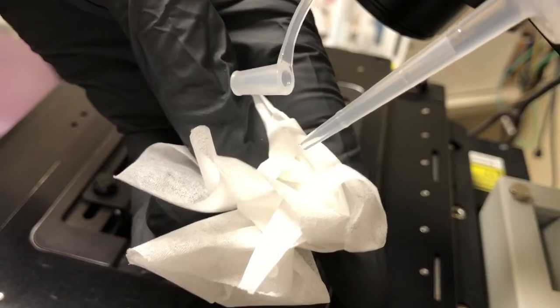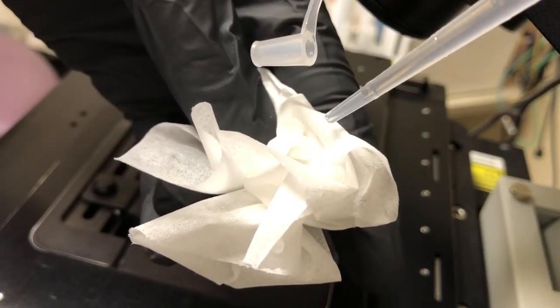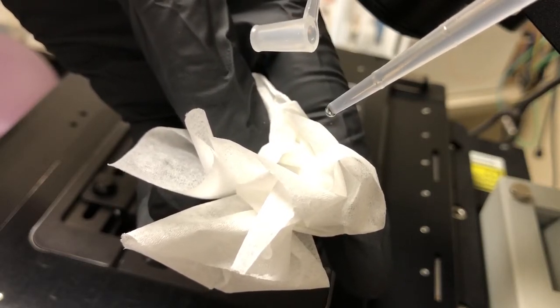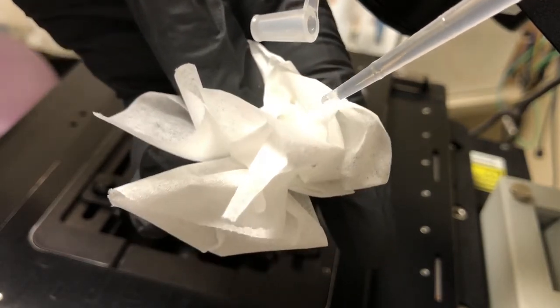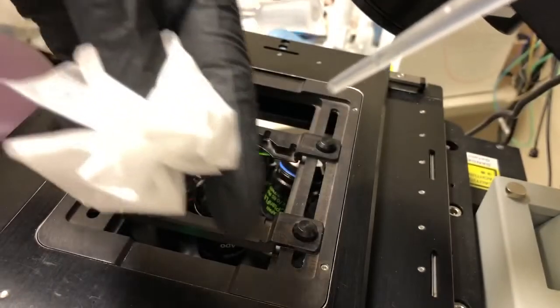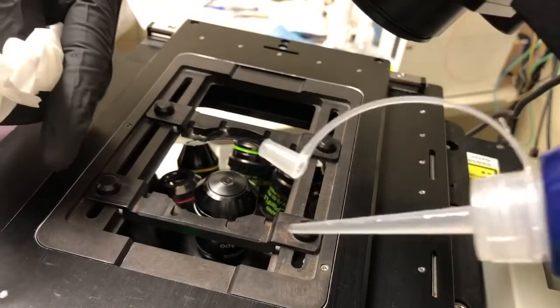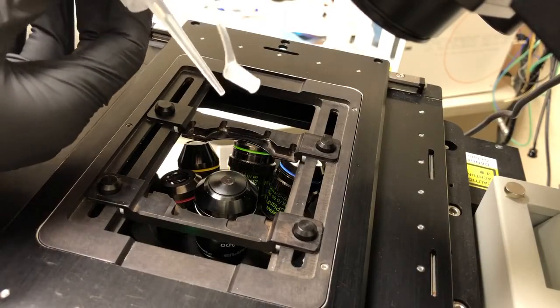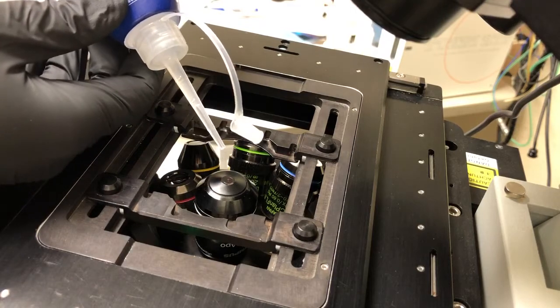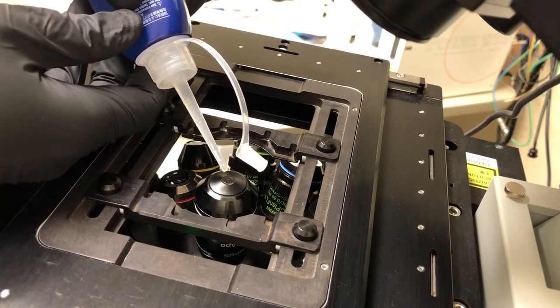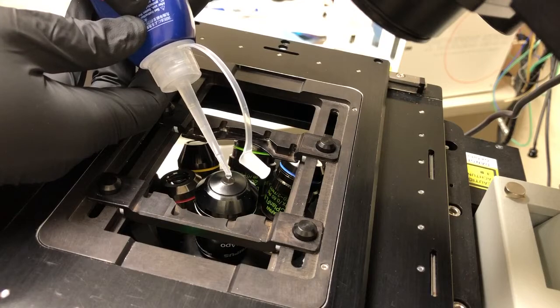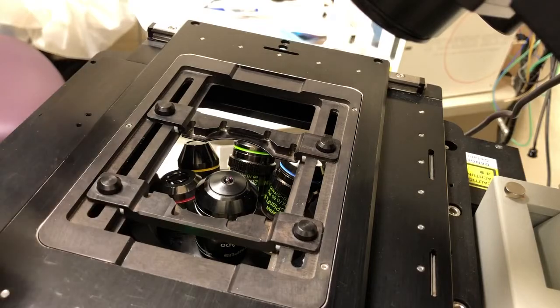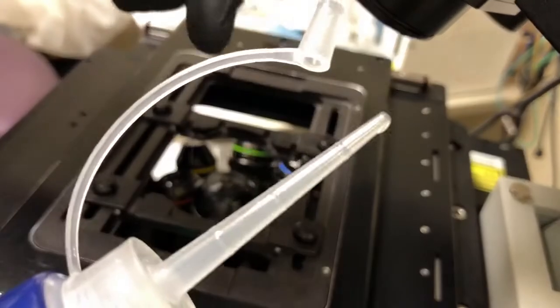If you gently press, check the tip and make sure there are no bubbles. If there aren't any bubbles, you can go directly to the objective. If there are, you would wipe them off here. In this case there weren't, but I wanted to show you what the wiping would look like. I'm going to go to another angle because it's a bit hard to do from there. Just put on a small drop. There we go. You can then recap this.